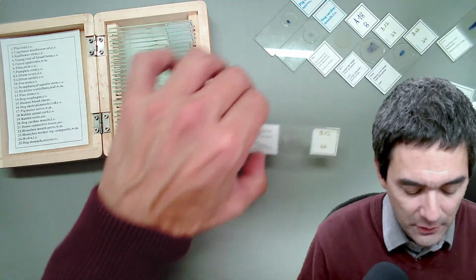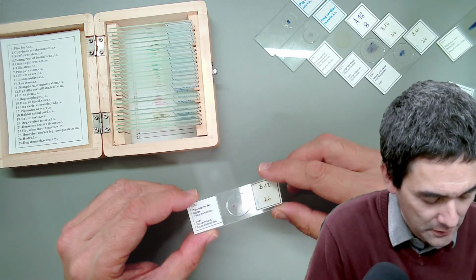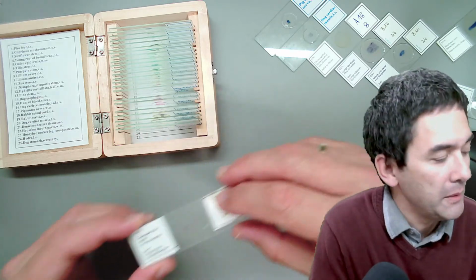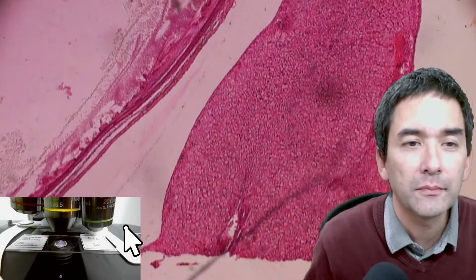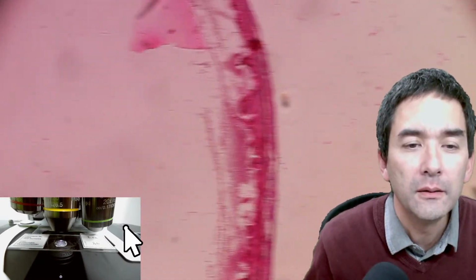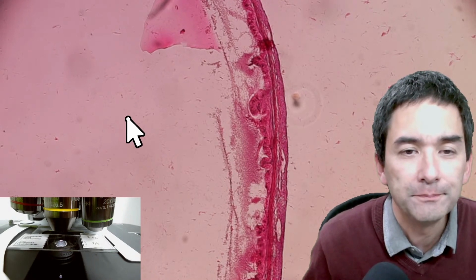This here is now the small intestine, also of a cat. So let's have a look here. We are actually able to see the infoldings of the small intestine. So let's see. Here it is. Again, fairly thin. So let's have a look here at the inside of the small intestine.